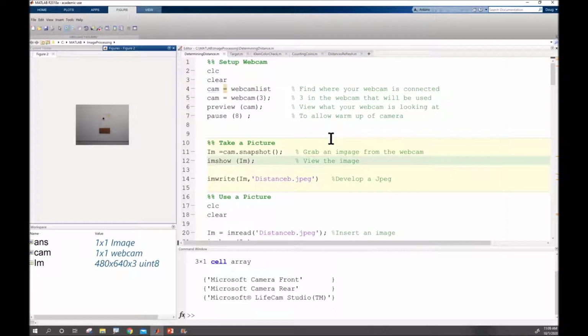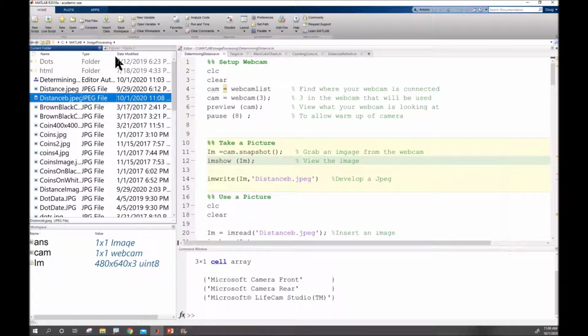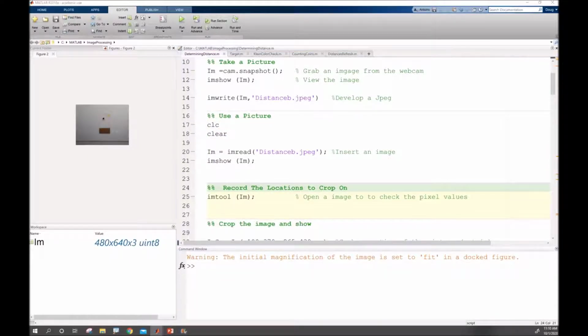So I do take a snapshot of it, so that way if I ever need to go back to it and reference it, I'm able to do that. I can see that distance B is what I'm naming it, and if I go into it, I can see distance B as a JPEG. And thus, if I leave that current location or I have to change my lighting or anything like that, at least I've got my initial image to work with. Once I have that, I'm going to clear out my image and bring it back in, and that way in future iterations I'm going to start on line 16 and work with my code because it's bringing in that exact same image right there. I'm going to bring in my image tool.